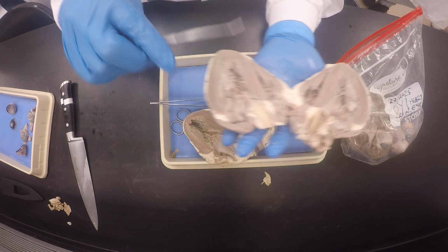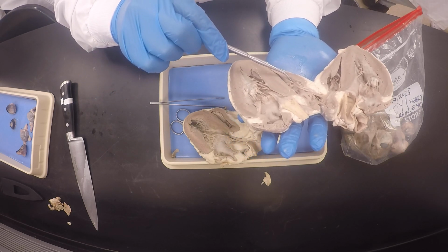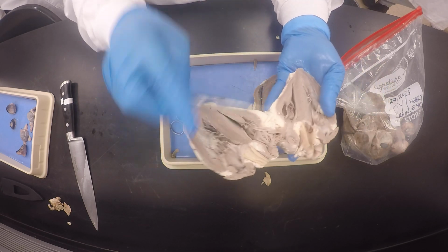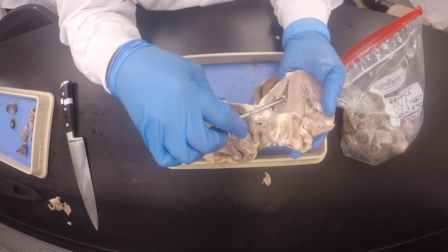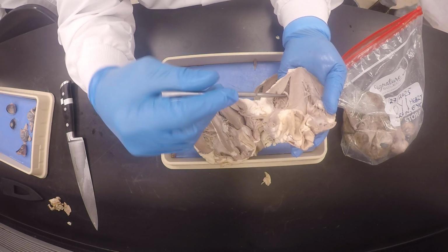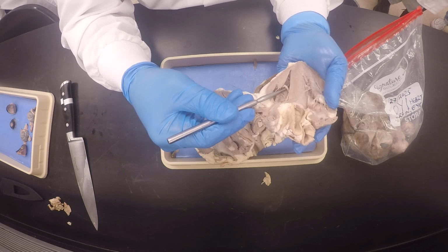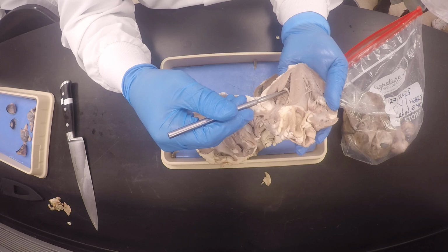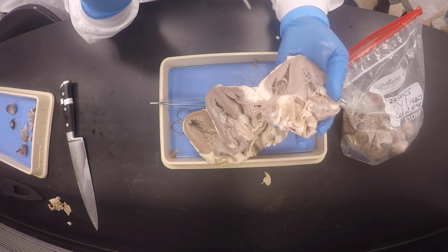So again, this is the interventricular septum. This is a papillary muscle. Okay, this papillary muscle is attached to the moderator band. In the exam, I'll be like, what's that thick string-like structure? The moderator band is much thicker, and there's only one of it. You'd say septomarginal trabecula or moderator band, whichever floats your boat. I take both. You understand?